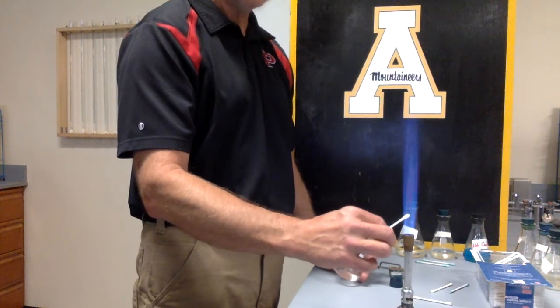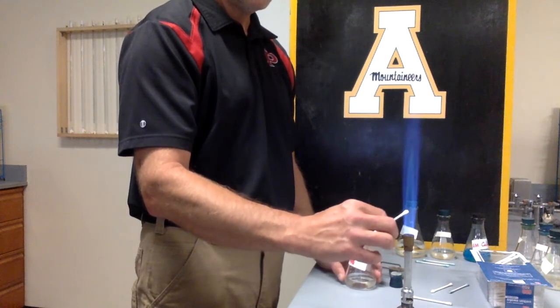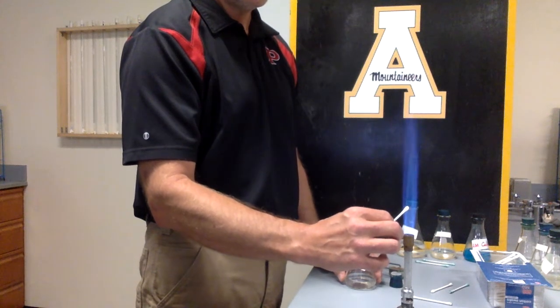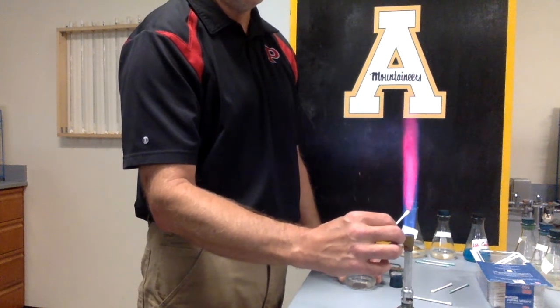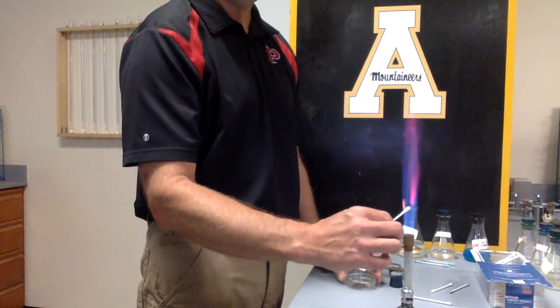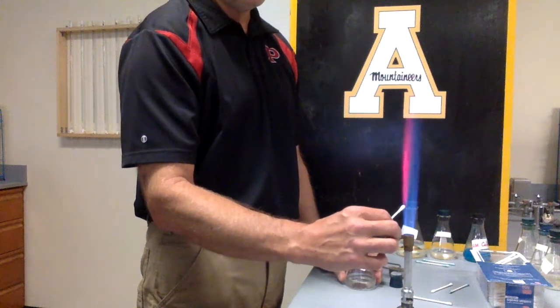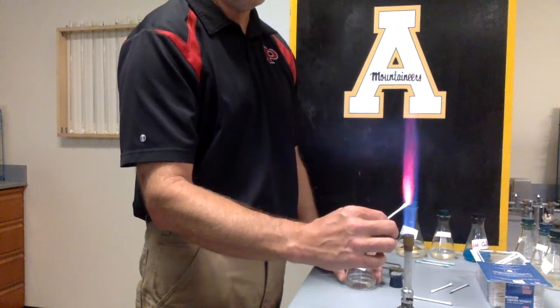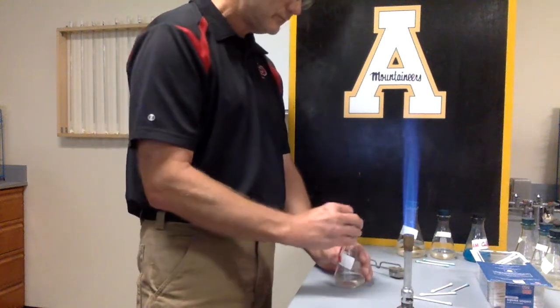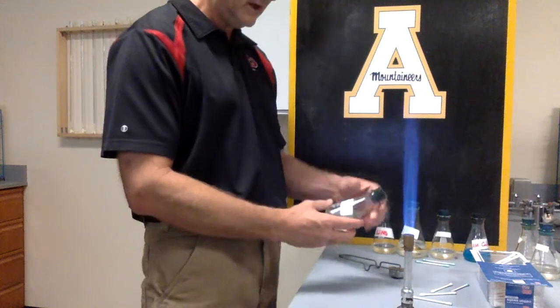All right. Oh, I'm sorry. This one is a lithium nitrate. And let's see what color lithium is going to be. It's got a little bit of a color. Ooh, yeah. Definitely got a big color change on that one. I call that a shock pink almost. You can definitely see the pink in that one. So that meant that lithium and strontium were pretty closely related.